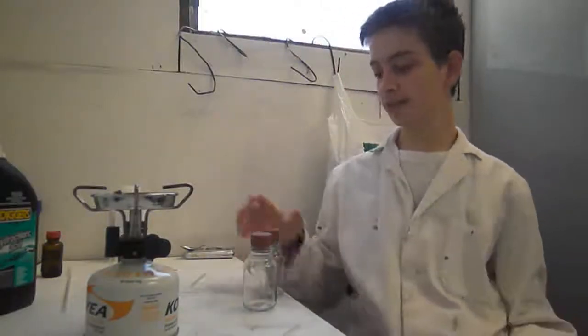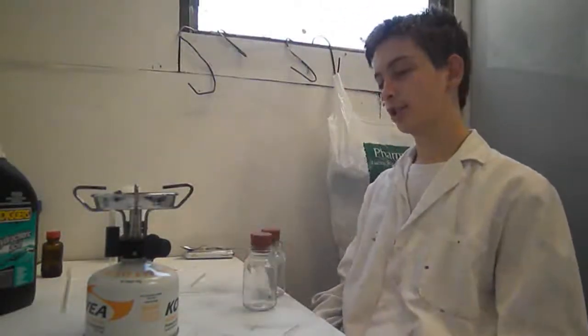I'm Josh. This is my lab. Today, I'll just be isolating some hydrogen gas.